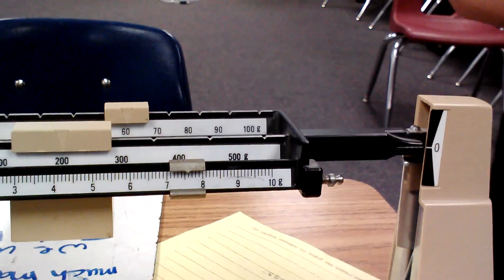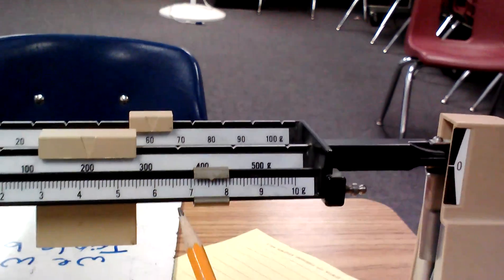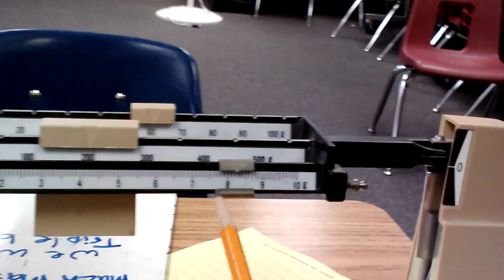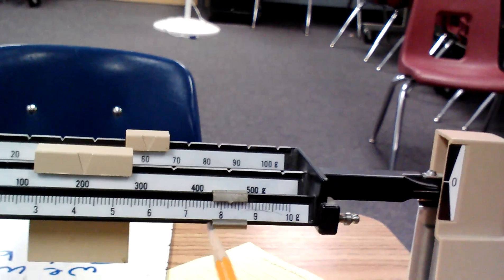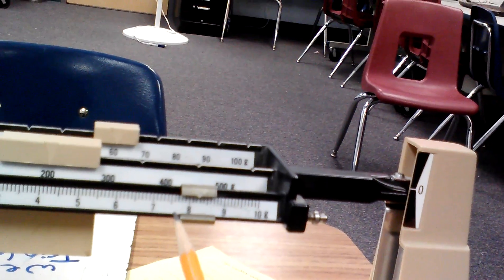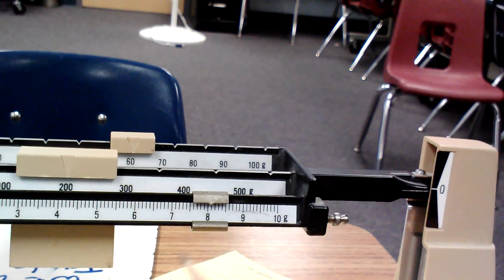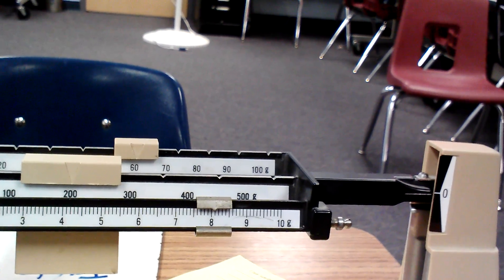And what Tim is trying to do, he's trying to get it as close as he possibly can. He's trying to get it in the middle. And so, what he's going to do, you got to be really patient. It's about good. We have to do a little back. And it's about good right there.